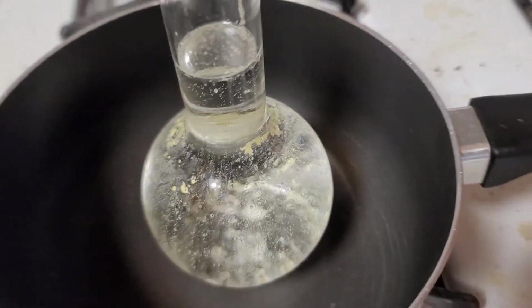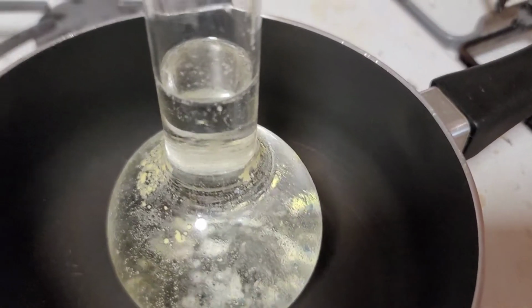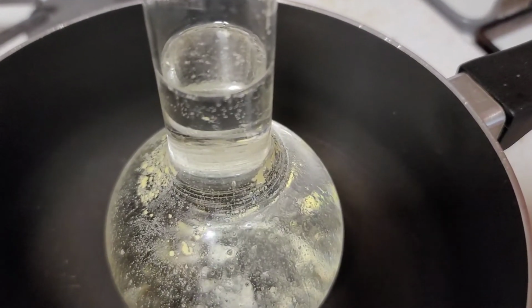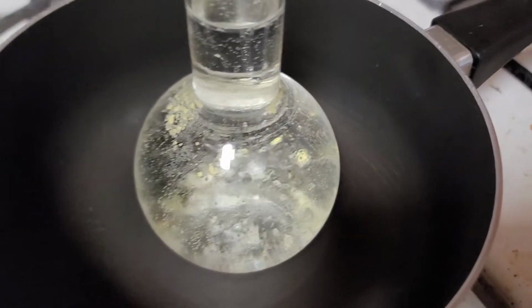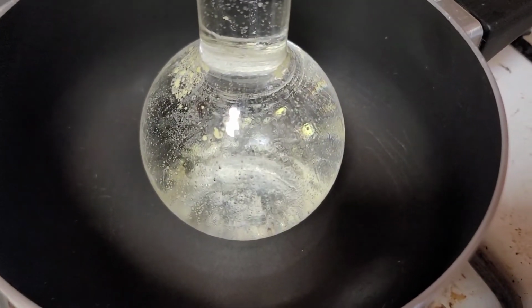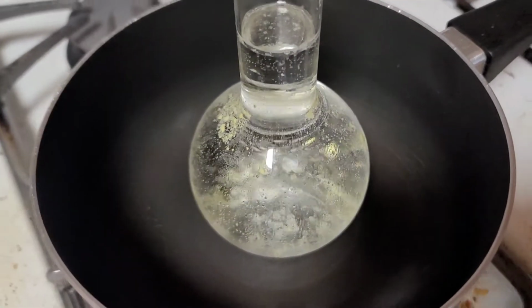I even put a brush in there and scrubbed and scrubbed and scrubbed, and you can see it's not clean. So what I've done is I've put distilled water inside of it. I use distilled water because I don't want any hard water stains on the glass. I've set it in a pot on the stove, heating it up. I want to get the water hot, possibly boiling inside the glass.